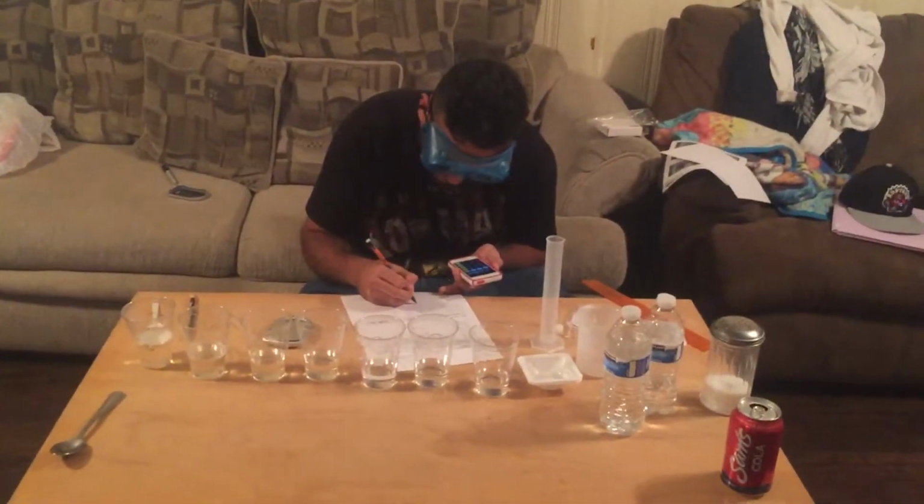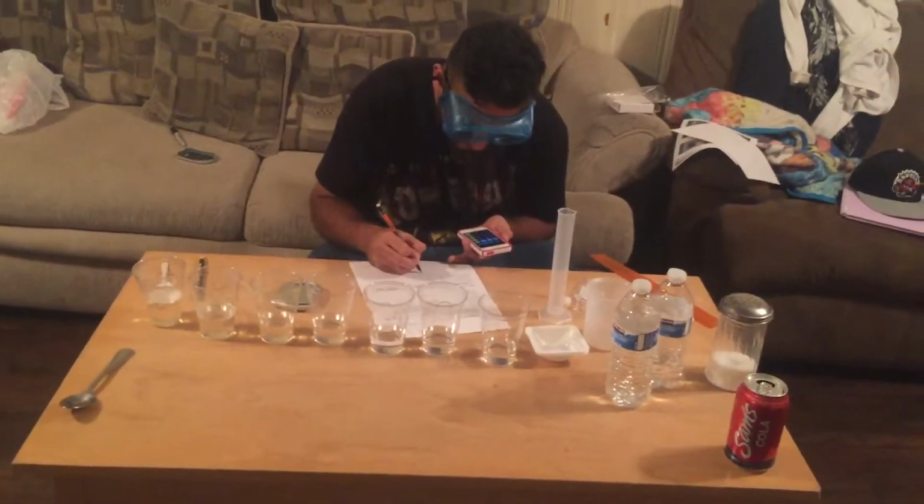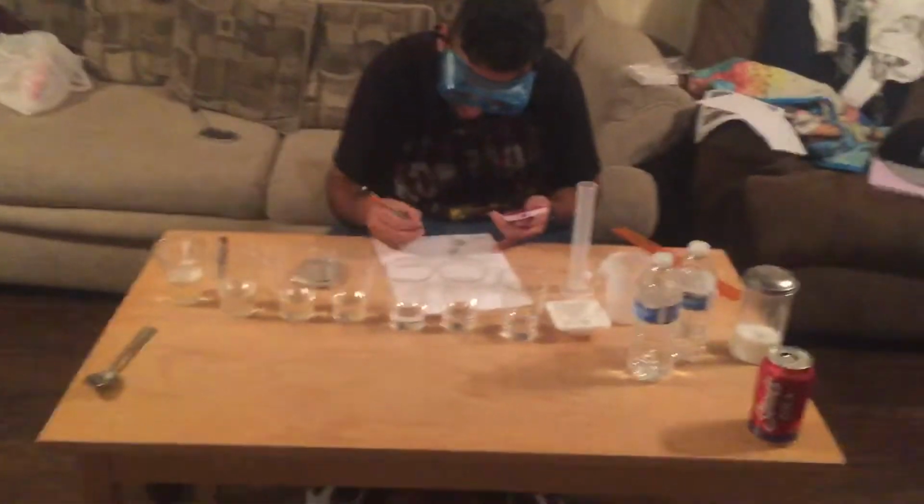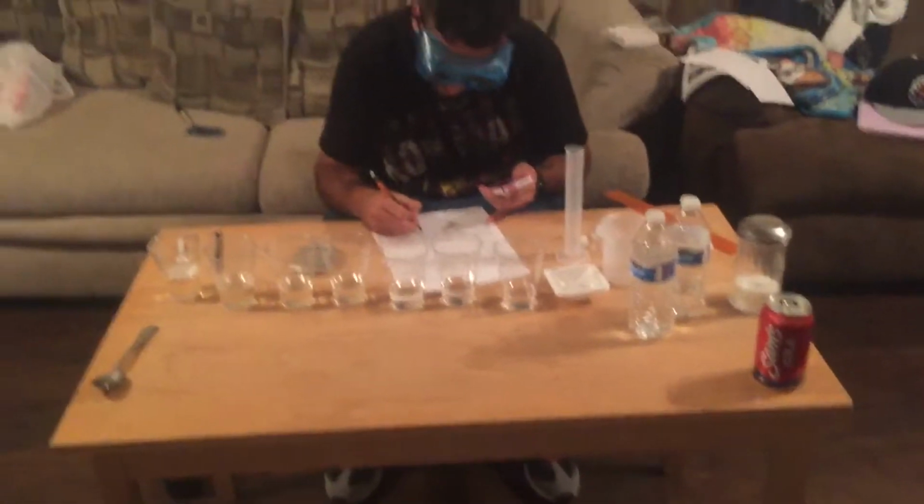I got about 4.898. Now I'm gonna do the one for the polyethylene.